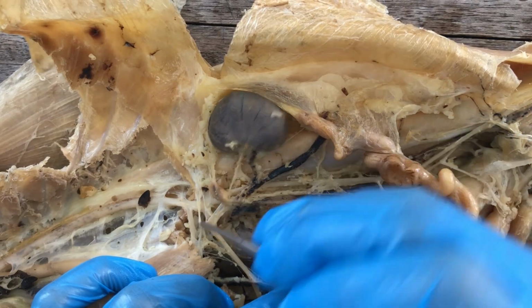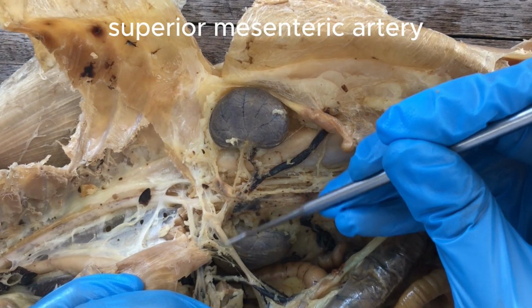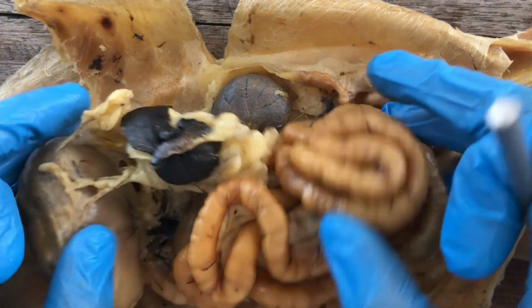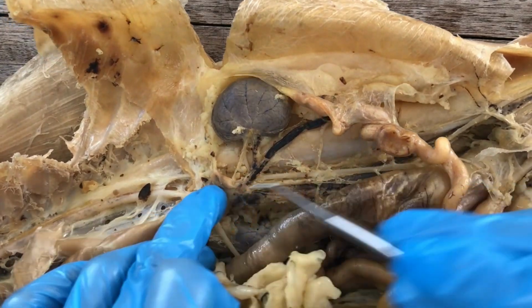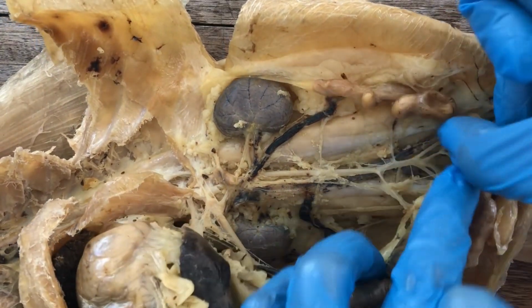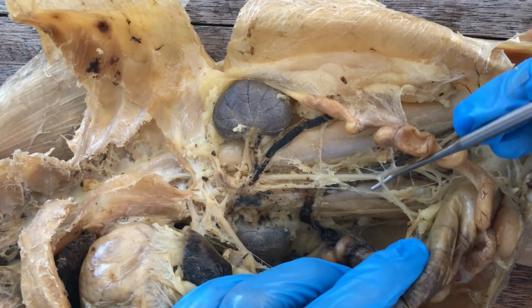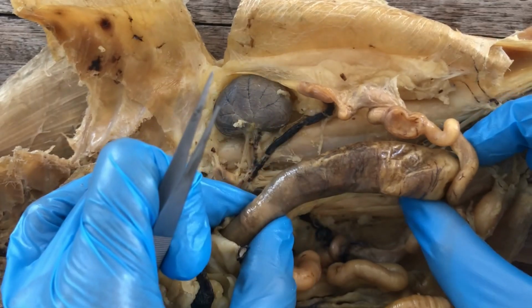And then just posterior to it is the superior mesenteric artery, supplying blood to the majority of the intestine. And then move posteriorly down here near the pelvis is the inferior mesenteric artery, supplying blood to the colon and the rectum.